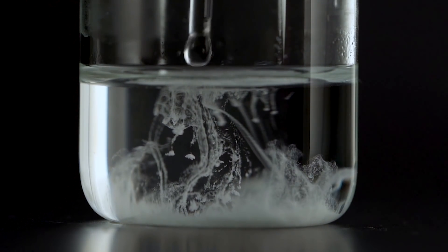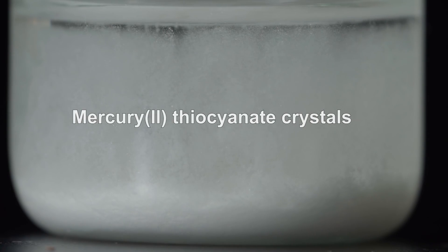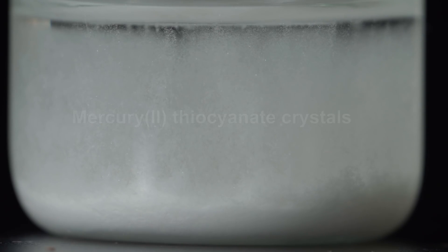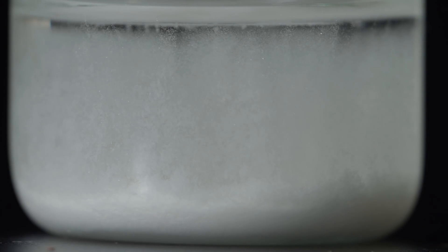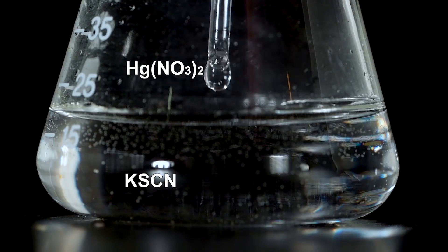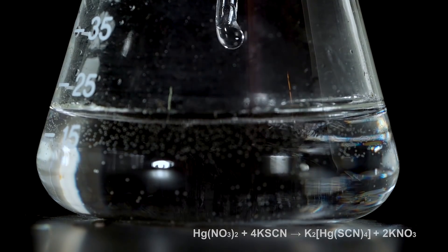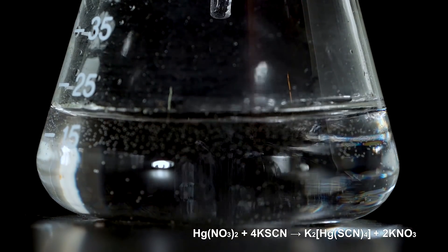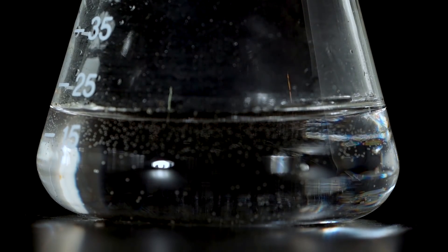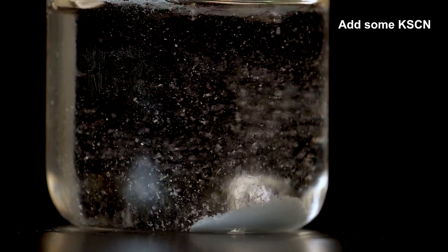It matters which reagent you add to which in this reaction. If you add potassium thiocyanate to mercury nitrate, mercury thiocyanate will precipitate out. However, if you do it the other way around, the forming precipitation will instantly dissolve, forming a complex salt — dipotassium tetrathiocyanatomercurate. The same method can be used to dissolve the formed precipitation of mercury thiocyanate in an excess of potassium thiocyanate.